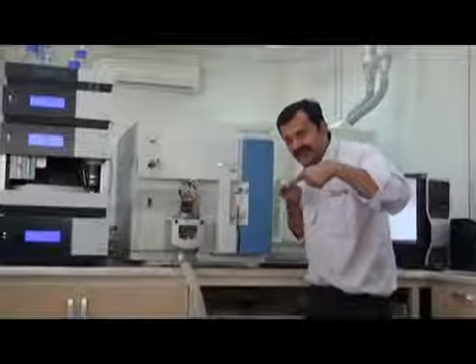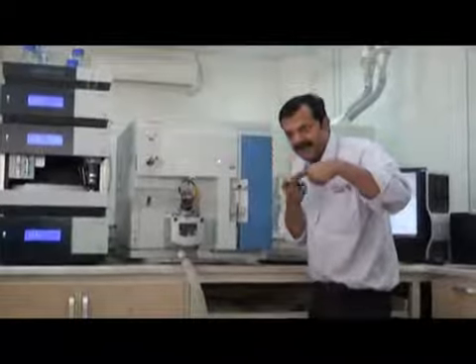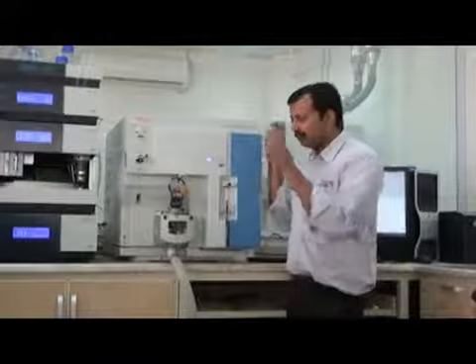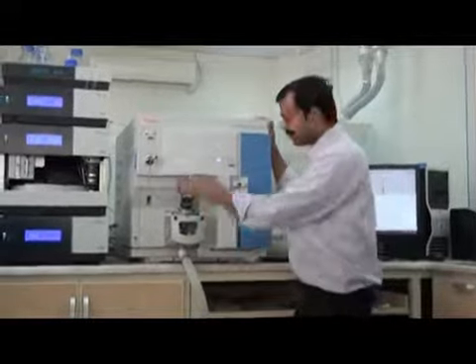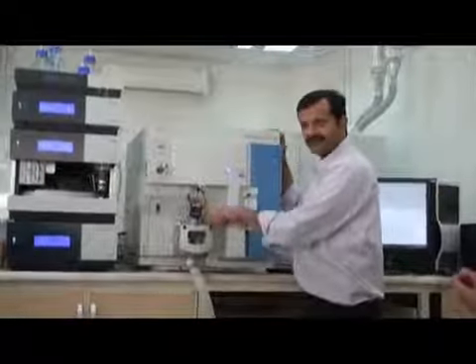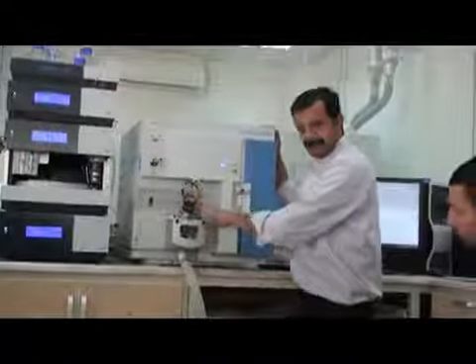Okay, near the probe. So you need another metal here to give the voltage. If you put that source here, you have to take it out from here. You have to put it here, for chemical ionization, APCI.